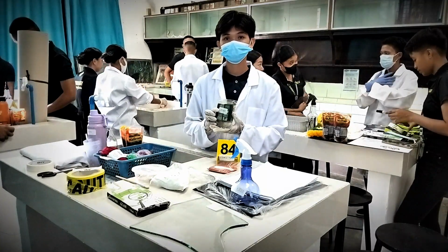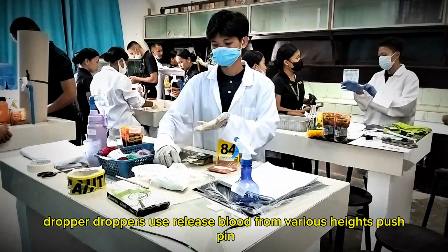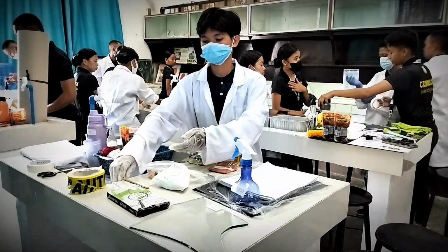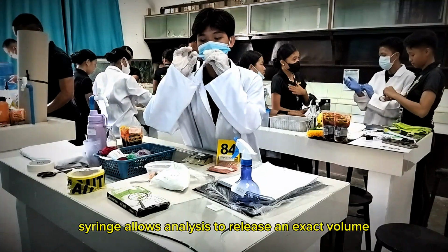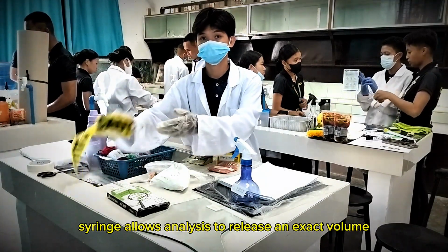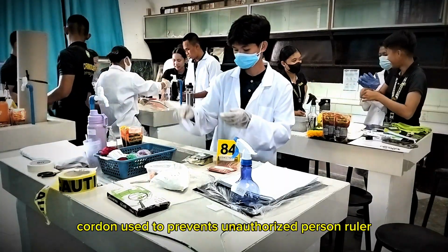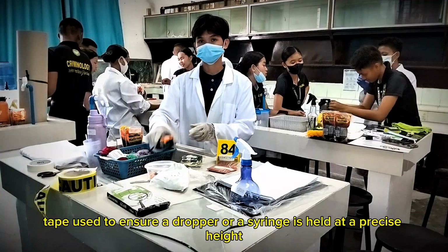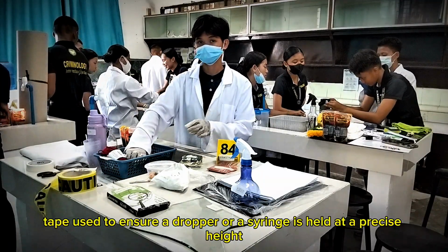Sponge. Dropper, droppers are used to release blood from various heights. Pushpin. Brush. Syringe, allows the analyst to release an exact amount of blood. Cordon, used to prevent unauthorized entry. Ruler. Measure tape, used to ensure a dropper or a syringe is held at a precise height.